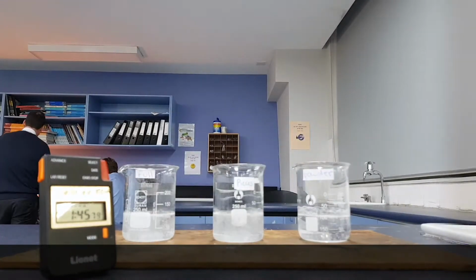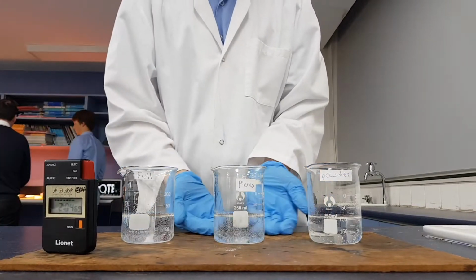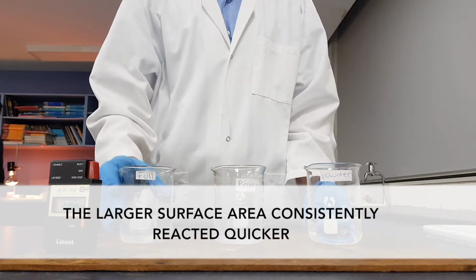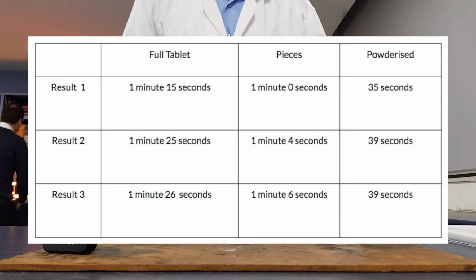The experiment was repeated 3 times for reliability, and the results were recorded and are as follows. The results were consistent in all 3 experiments and presented a clear trend. The larger surface area consistently reacted quicker. The table shows a clear pattern of the experiment.